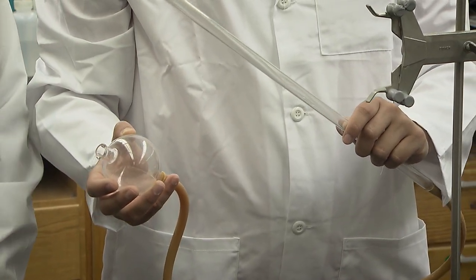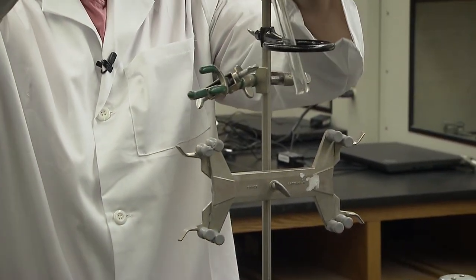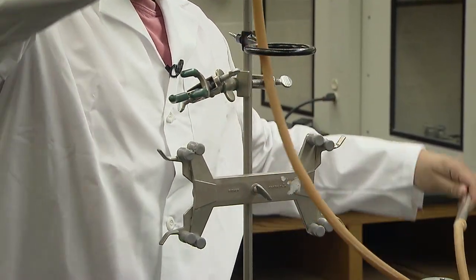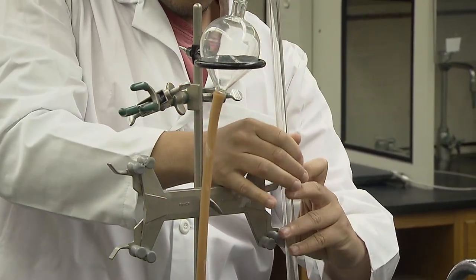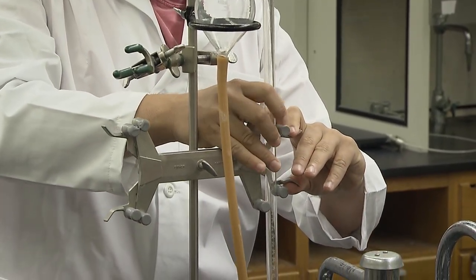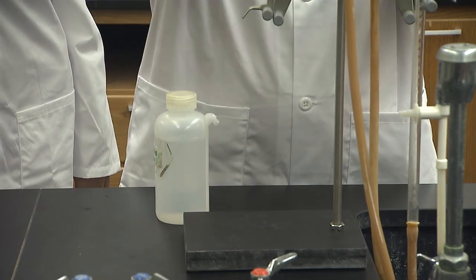The bulb and burette apparatus can be found on the cart. The top of the burette is passed through the top of the ring clamp. The bulb comes to rest in the ring, and the burette is clamped in such a way to prevent the hose from crimping. Use the sink to help give the hose more space.